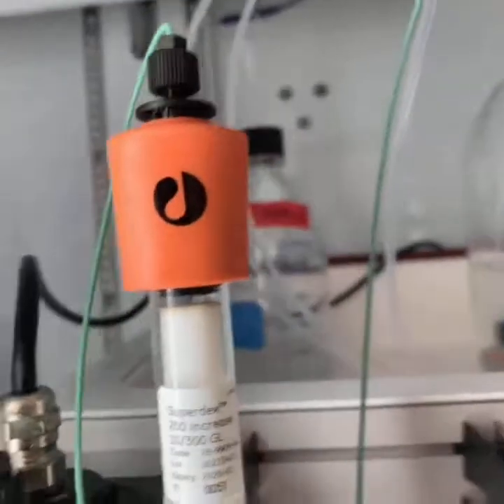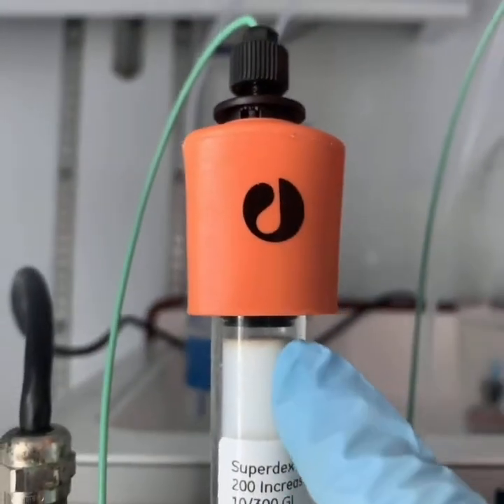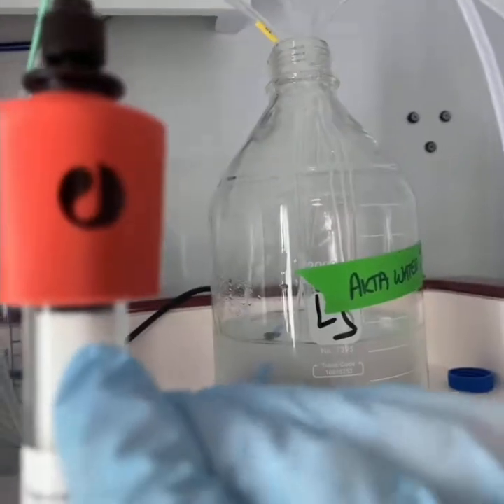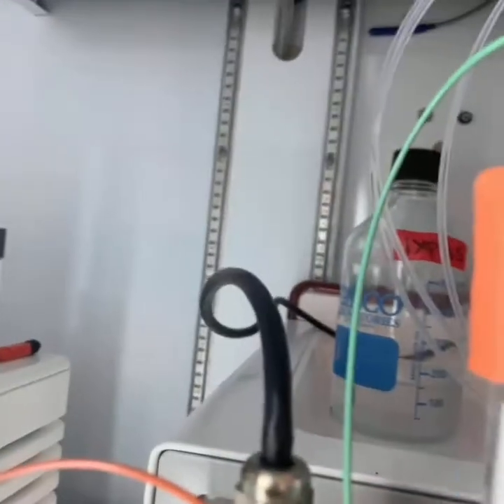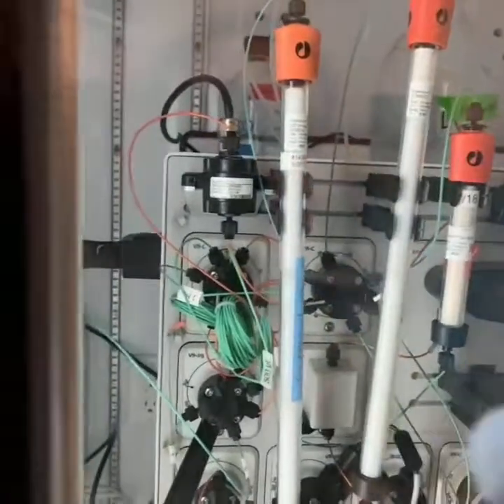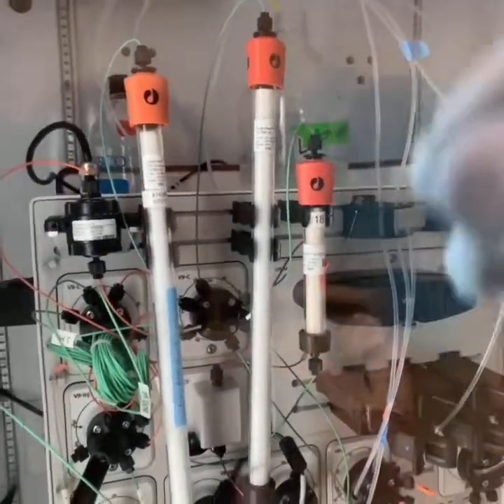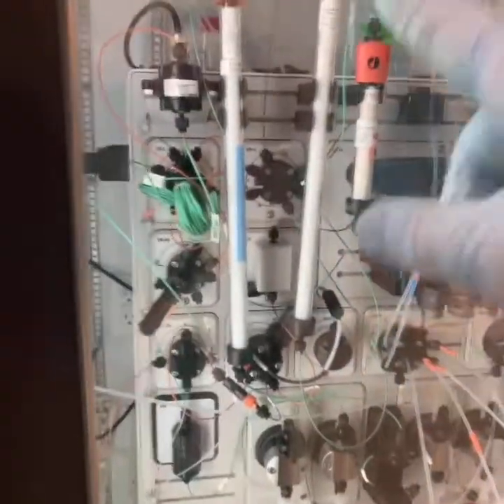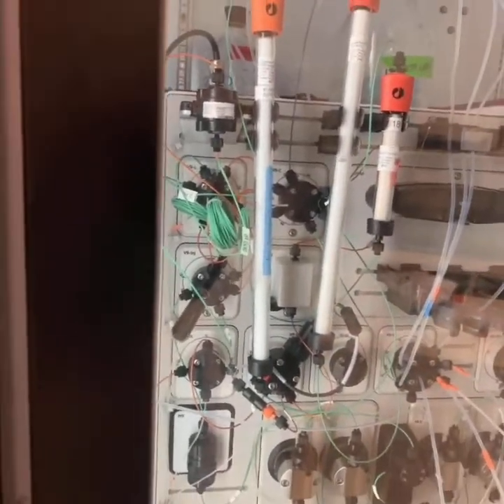And so you can see that this column is kind of messed up. You see this big gap in the top? That shouldn't be there. You should have the top of this right there. And so this suggests that there's too much pressure. And in fact, when I tried to run that column I could only run it really slowly without the pressure going up. So there's ways to try to address that gap at least. And you can actually remove the top and try to replace the filter on the top and then put it down. But it's really bad when you have that with size exclusion columns because then it changes the elution volumes and stuff. So that's not good. So it's important to take really good care of everything in your ÄKTA.